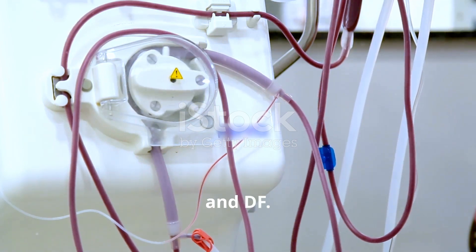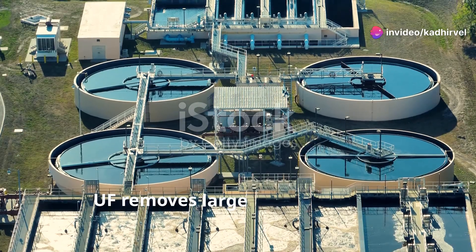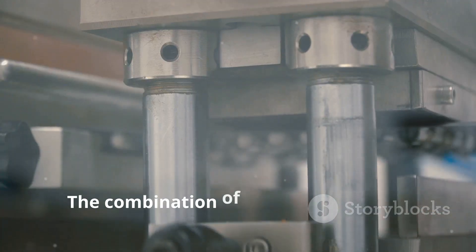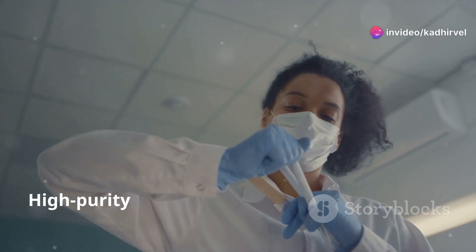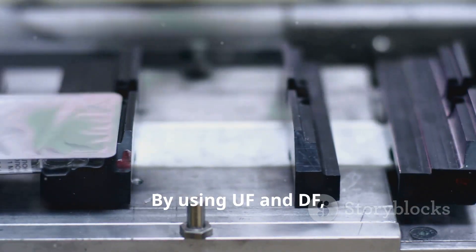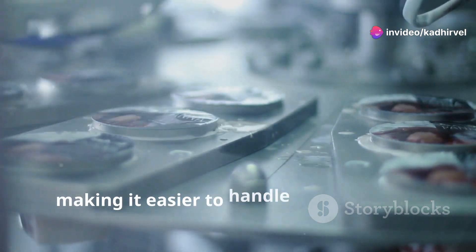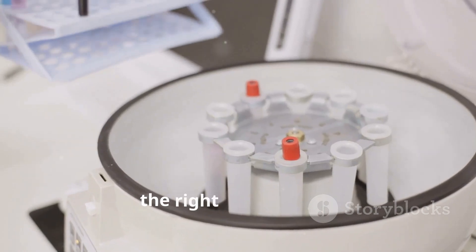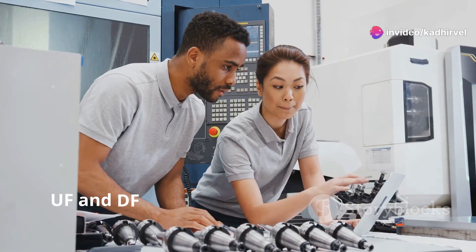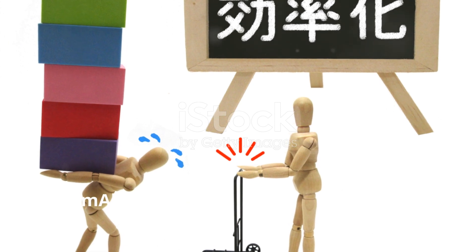UF and DF complement each other in MABs production. Together, they ensure high purity and concentration of MABs. UF removes large impurities and concentrates the antibodies, while DF takes care of small impurities and fine-tunes the buffer. The combination of UF and DF leads to better product quality. High purity MABs are crucial for patient safety, as impurities can affect efficacy and cause adverse reactions. These processes also improve process efficiency — UF reduces volume, making it easier to handle large batches, and DF ensures the final product is in the right formulation. This combination saves time and reduces costs. Scalability is another benefit, as UF and DF can be scaled up or down based on production needs, ensuring manufacturers can produce MABs at different scales efficiently.